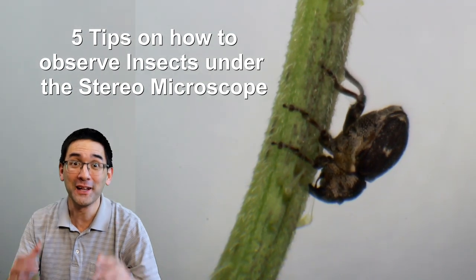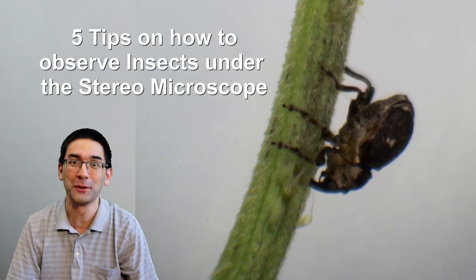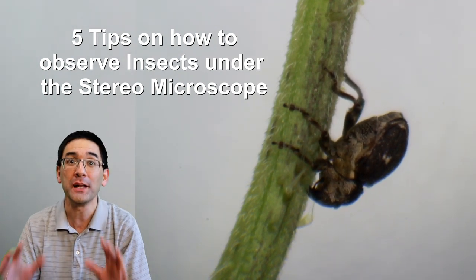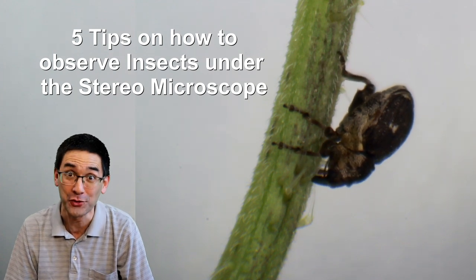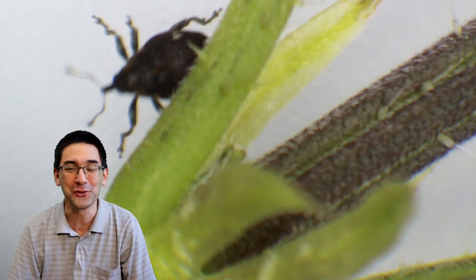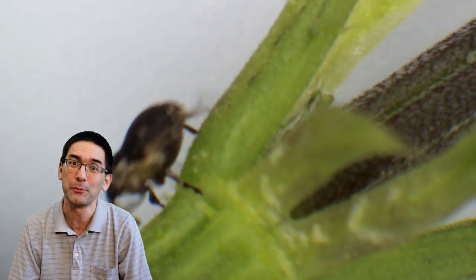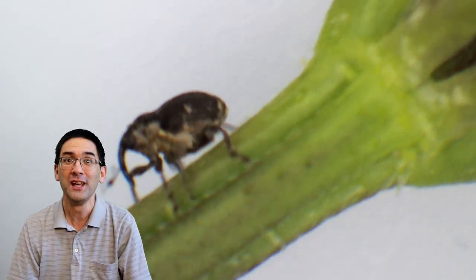Hi, Microbe Hunter here. Today, no microbe hunting but rather insect hunting. I'm going to show you five tips on how you can better observe insects under the stereo microscope, and I hope to also get you interested in stereo microscopy, because most of my videos up to this point were about compound microscopes.